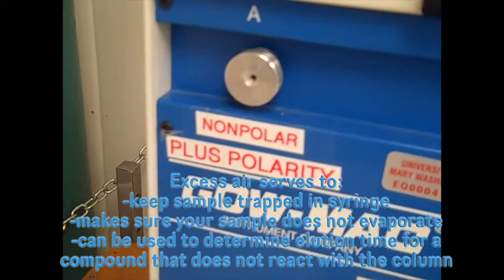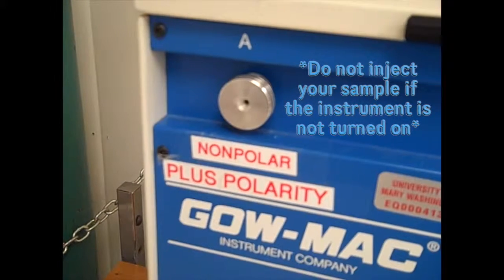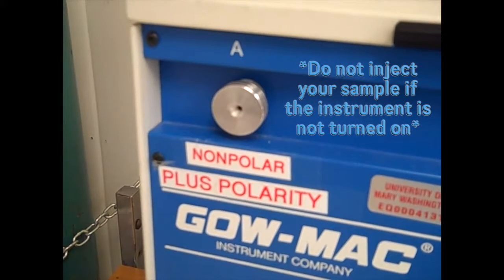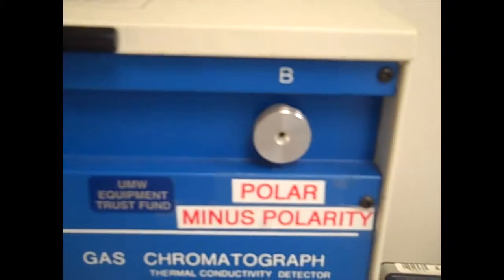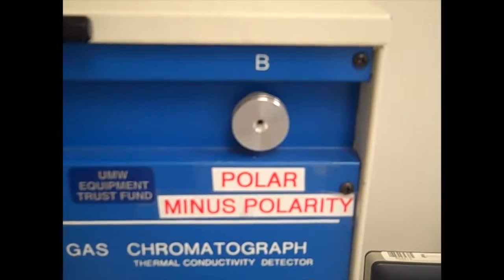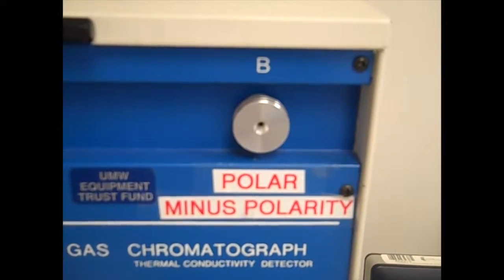If the polarity switch is positive, inject the sample into the non-polar injector port, A. If the polarity switch is negative, inject the sample into the polar injector port, B.